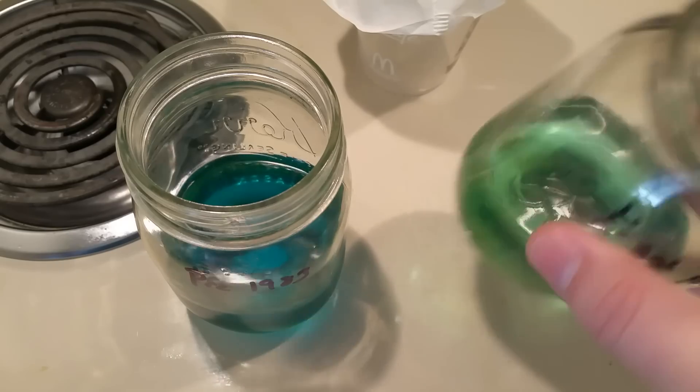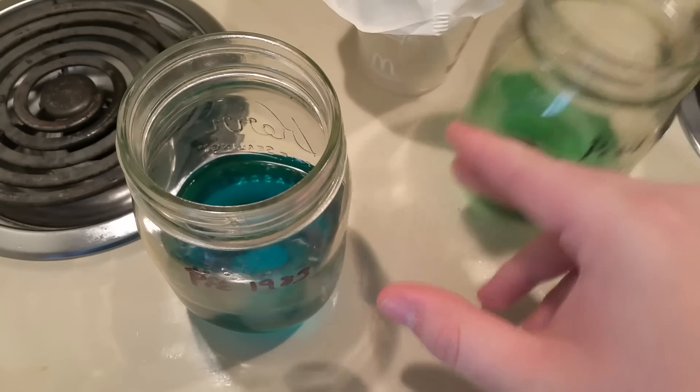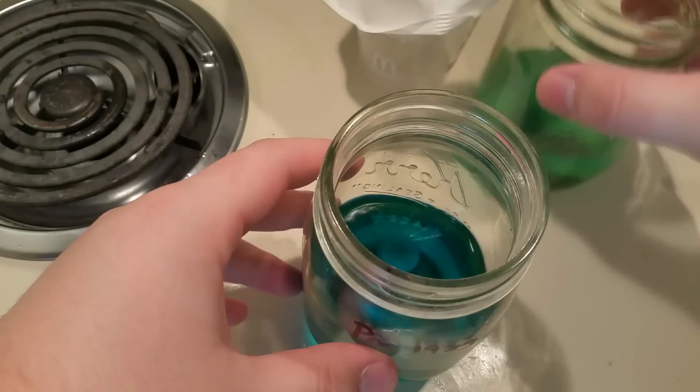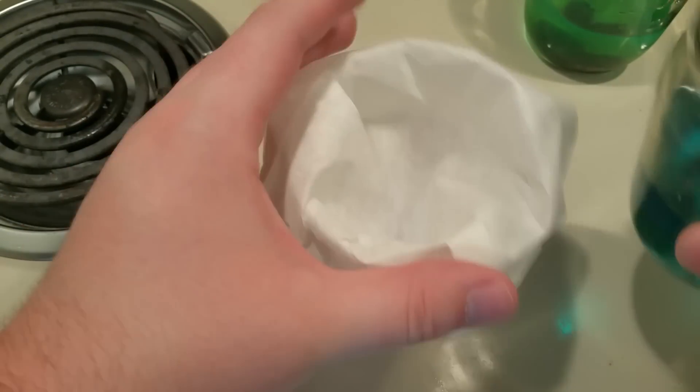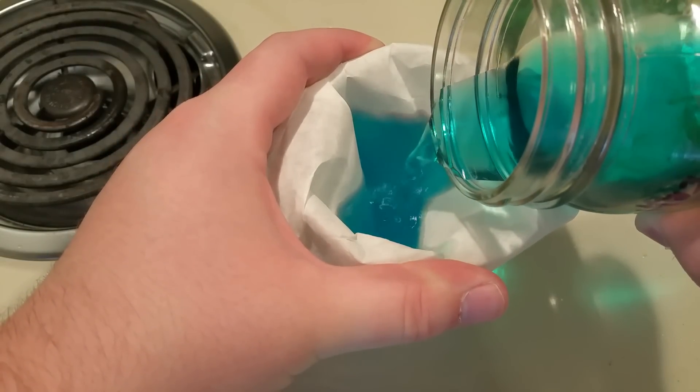The green color could be copper chlorides, or it's just some impurity that could have been in the vinegar or on the outside of the pennies, because I really didn't clean them that well. I figured any insolubles would have been taken care of in the filtration.